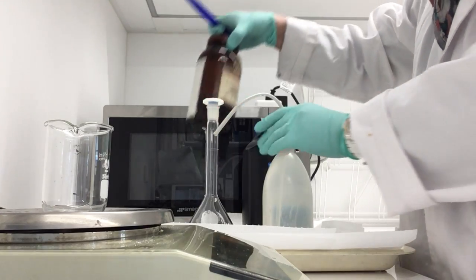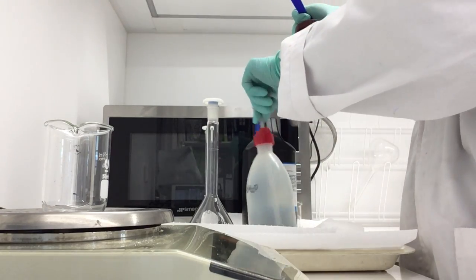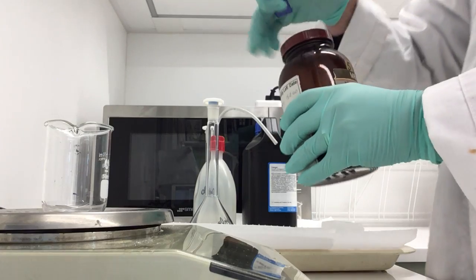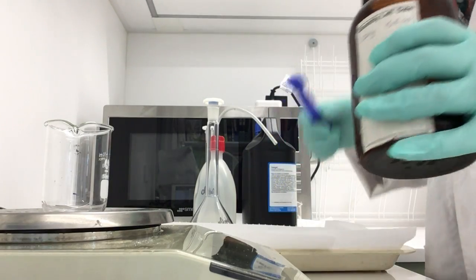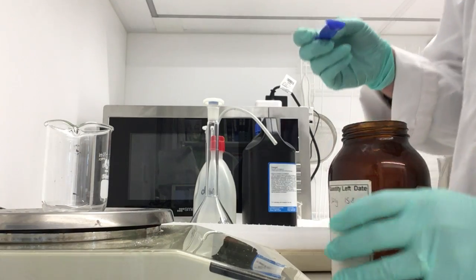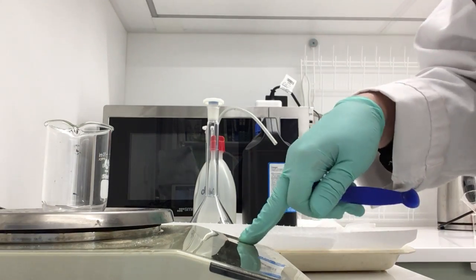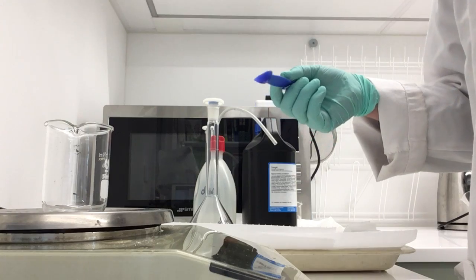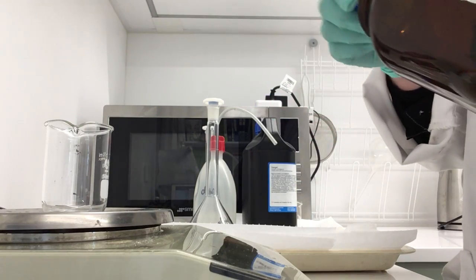So I'll weigh out 0.79 grams into my beaker and then transfer that into my standard flask. Let's re-zero my balance, 0.79.